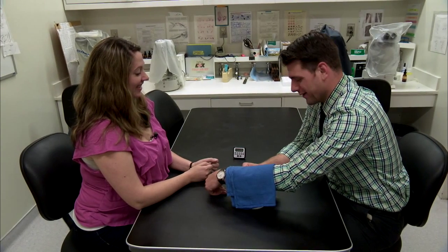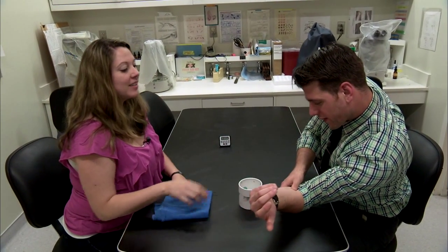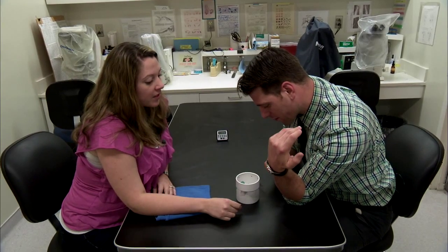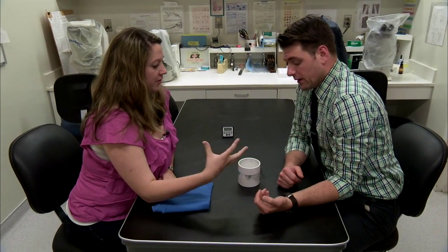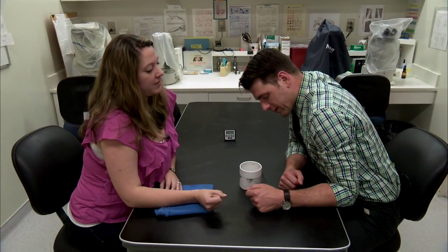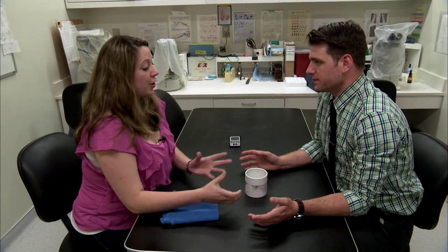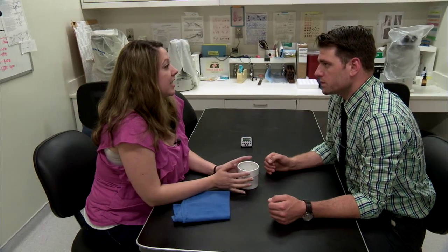After what seemed like an hour, the five minutes was up. How do you feel? Itchy — like insects were just biting my arm for five minutes. You've got a couple of little pinpricks there starting to light up — you can see some of my blood is in there. The ones that have fed are moving a lot slower now, they're super full. You can see they've got big, fat, bright red bellies — filled with my blood. So we know now that these are fed, but we have to make sure that they're actually infected. To do that, we have to dissect out their salivary glands and see if there are parasites in there.